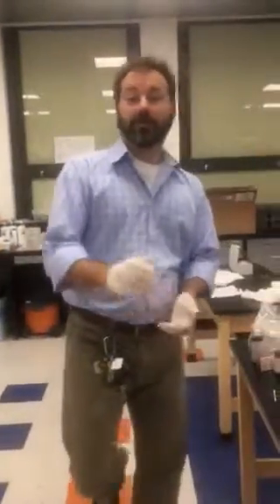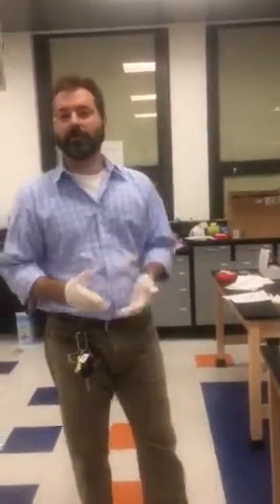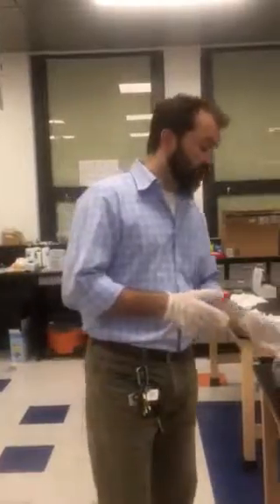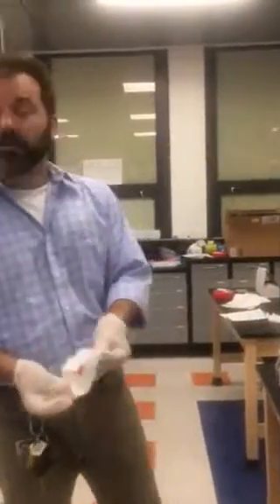So today we're gonna look at how to do a presumptive blood test using two methods. One is gonna be if the sample of blood is wet. The other if the sample of blood is dry, as if found at the crime scene on this shirt.